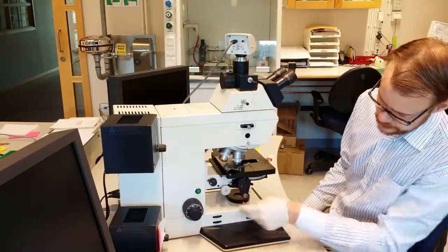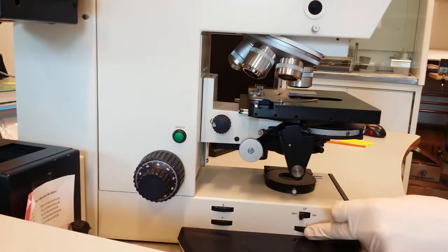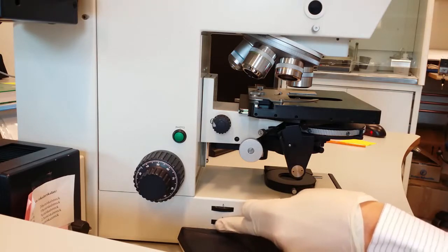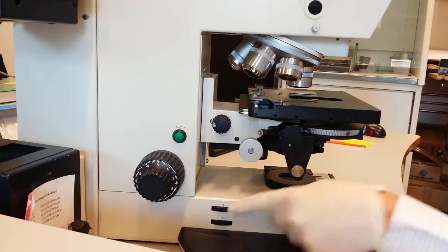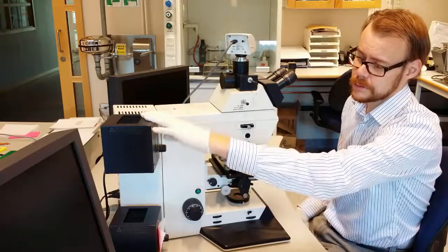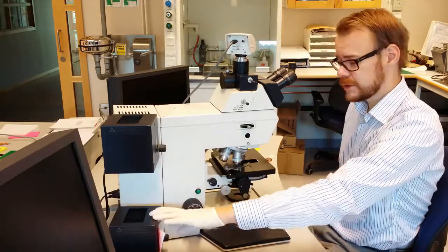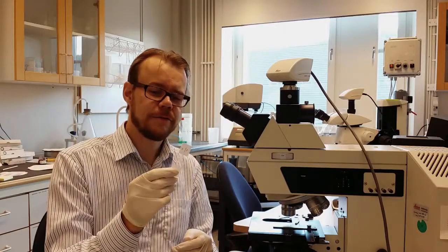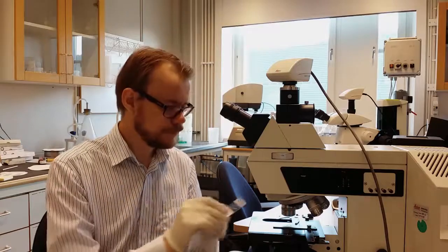On the bottom here you have options to control the light source. You have the intensity of the lamp, you have the focusing of the lamp, you have an aperture of the lamp. And there are two light sources you see here. The one on top is used for the reflective light option and the one at the bottom is used for the transmitted light option. Here I have the samples of the lily of the valley. On this I will demonstrate the polarization light method.